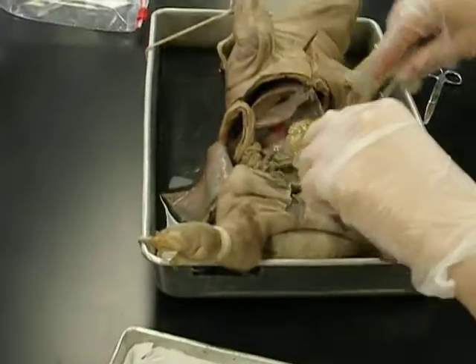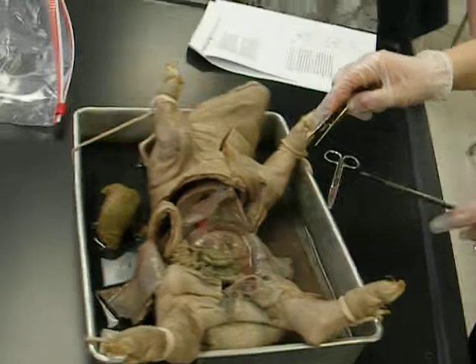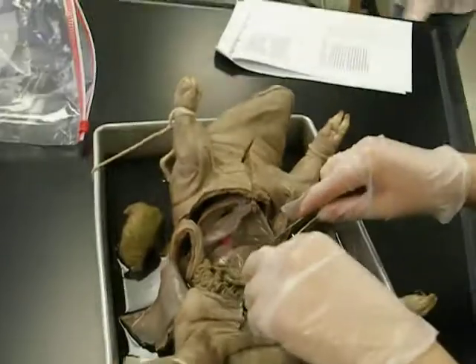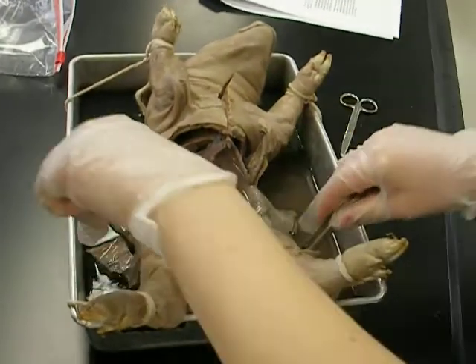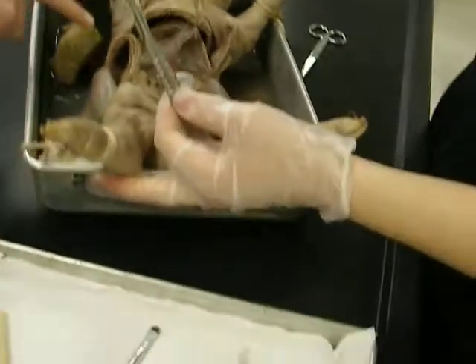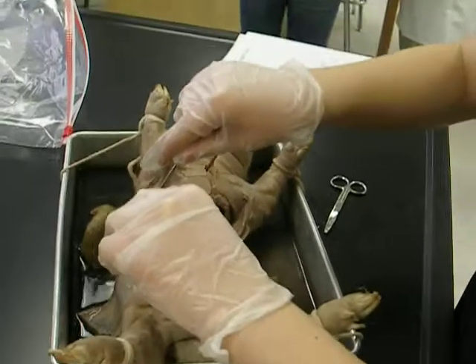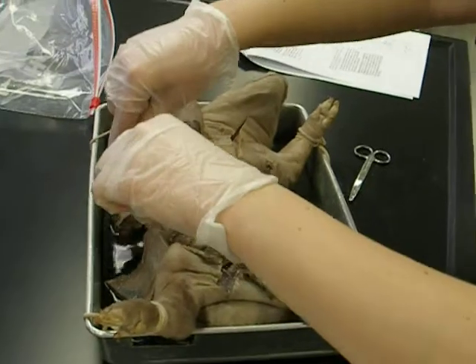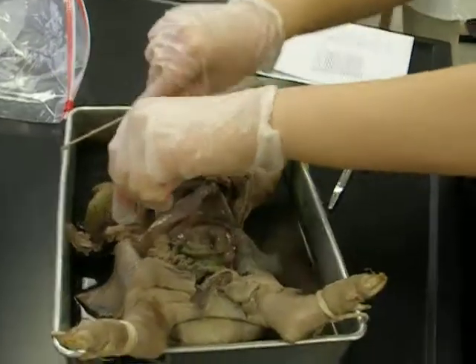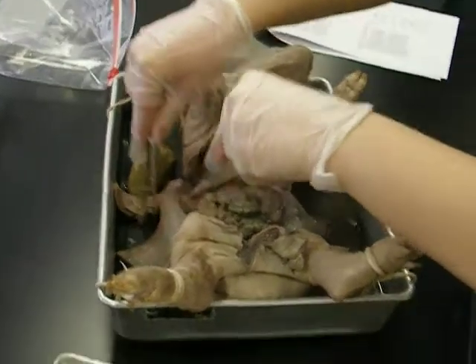Why are you so nasty looking? I don't know. Yours looks normal, like that liver looks normal. Ours looks green and gross. As normal as a fetal pig's. Okay, flip that side out because I can't see anything. That side right there. No, this side. Oh my god. Flip it over. You have to do it harder. There you go. That's lovely.